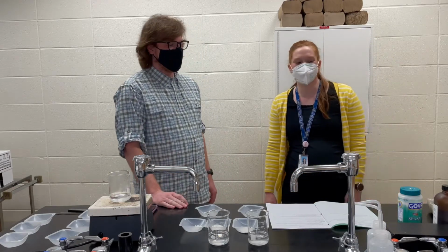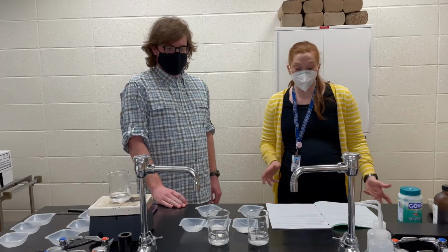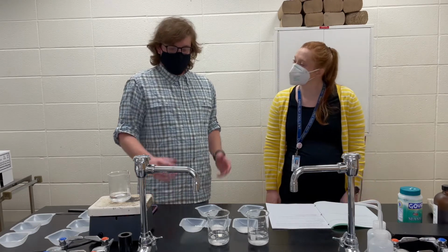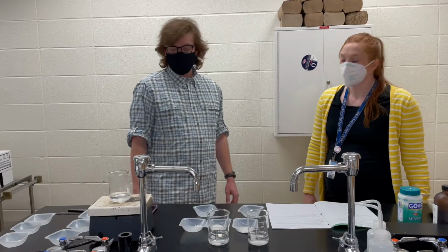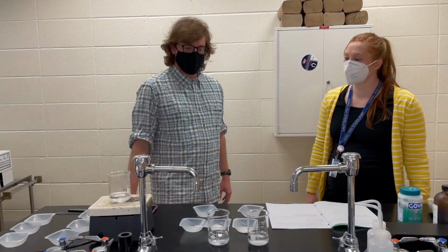We're gonna do a little solubility and solutions lab here. So we've got 4 different parts. We're gonna be looking at all of these different variables that have an effect on solubility. To walk you through a bit of the setup, we've already weighed out the appropriate amounts of salt for all the different parts. So we've got 0.25 grams set up throughout the table.